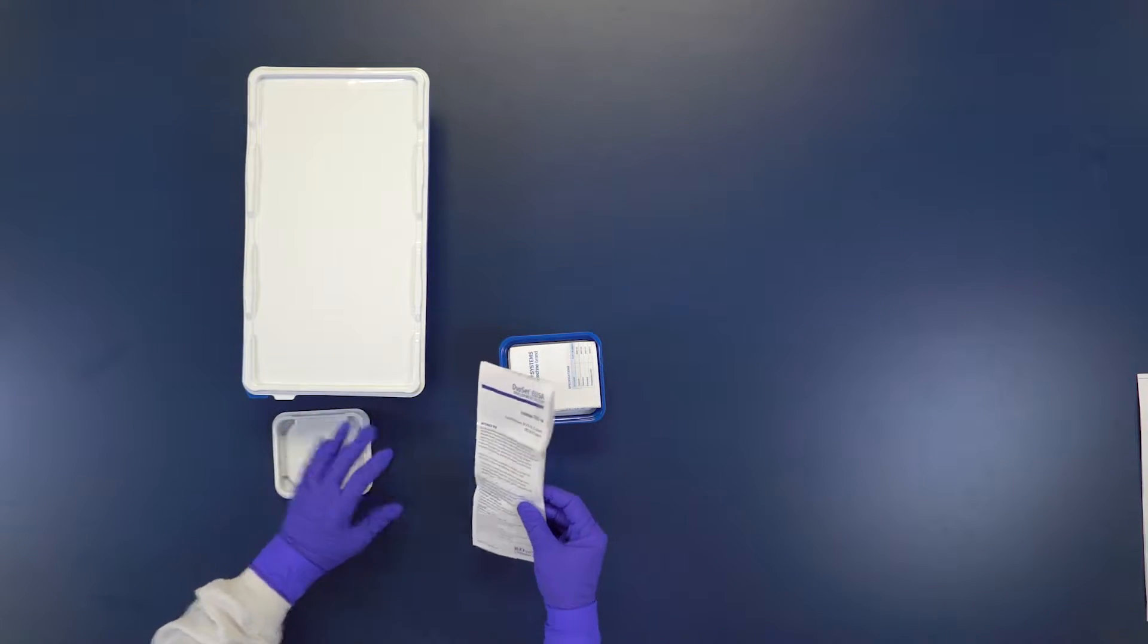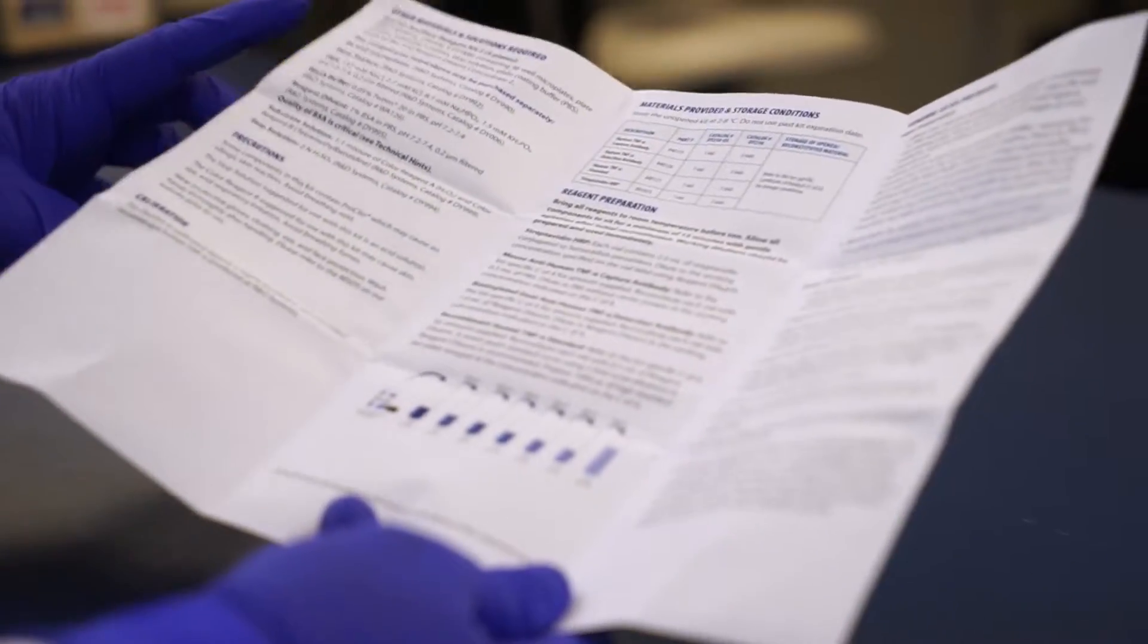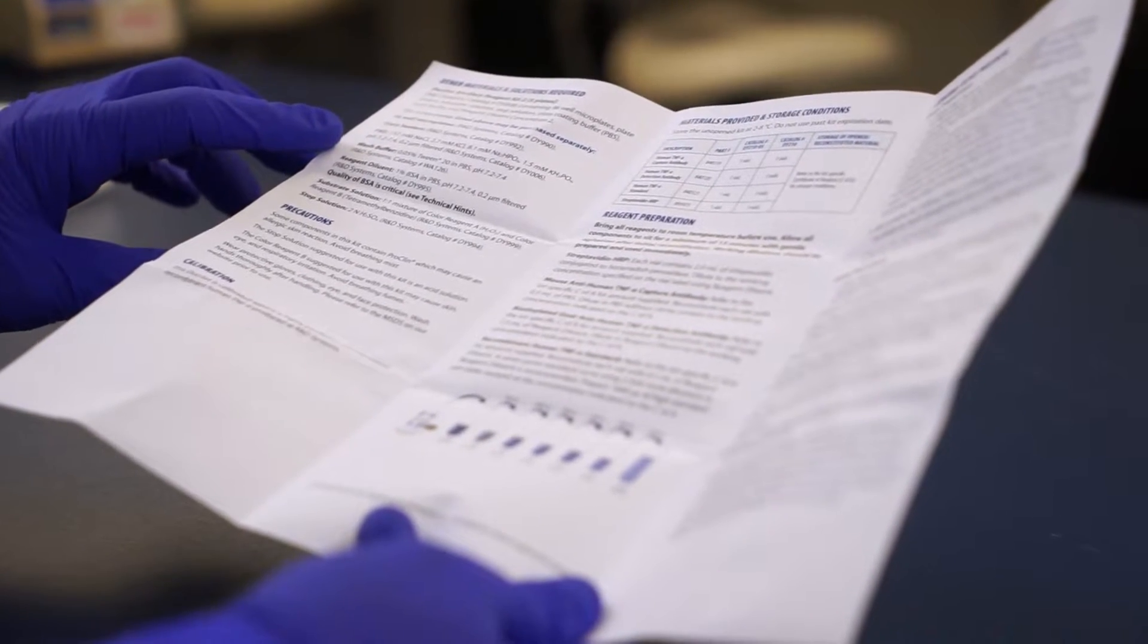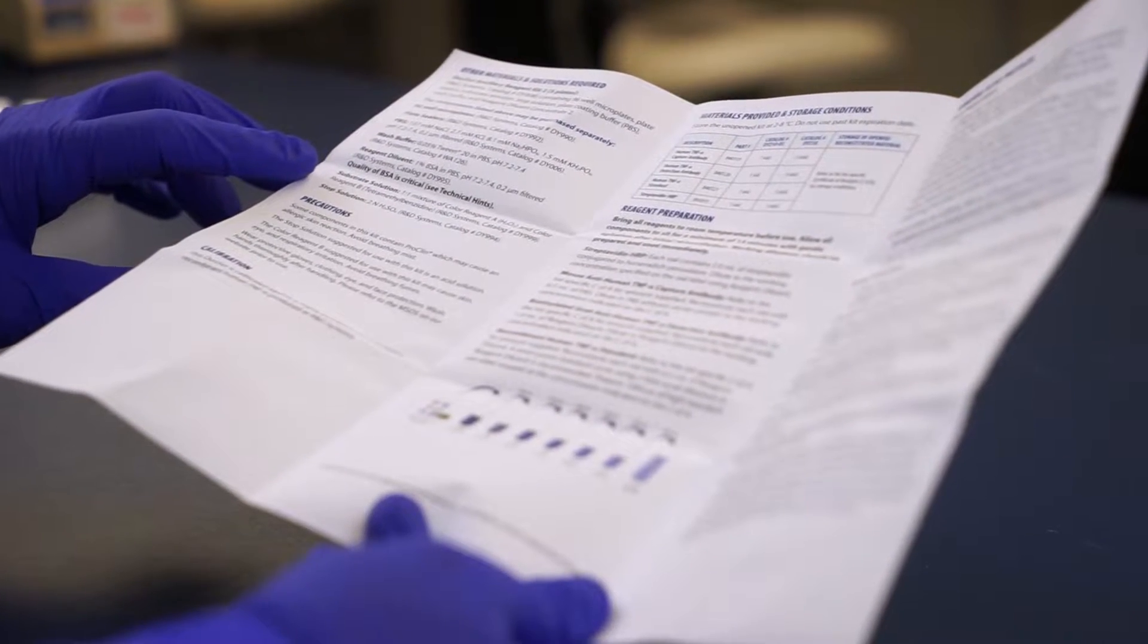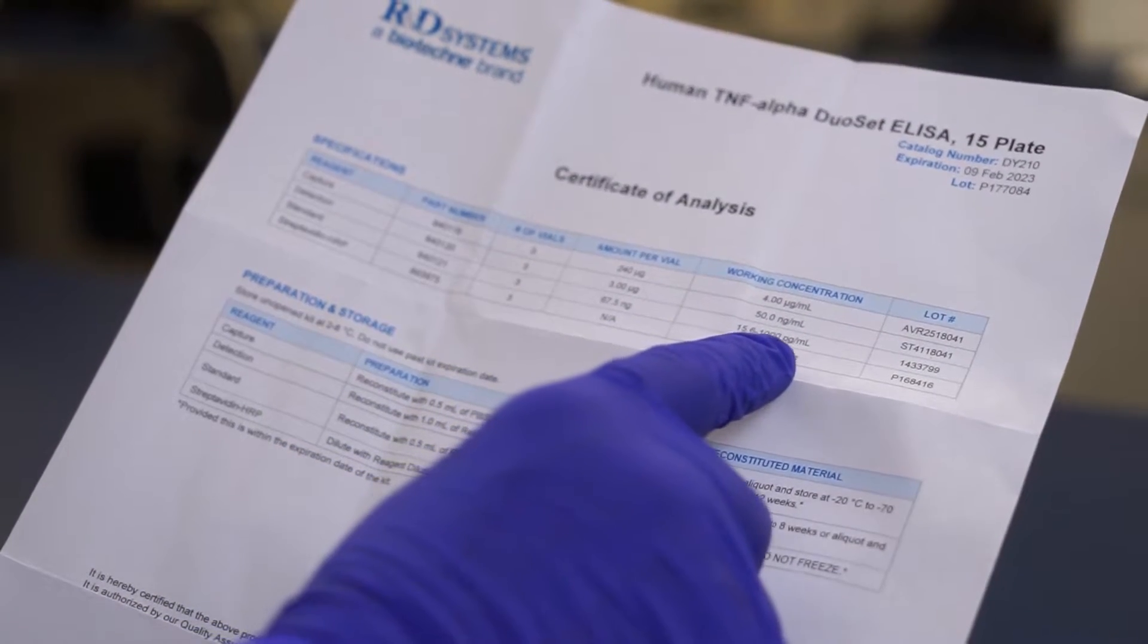Additional assay optimization and validation is recommended for testing complex matrices such as serum and plasma. Read the assay insert in its entirety before using this product and refer to the lot specific certificate of analysis for component concentrations as they may vary.